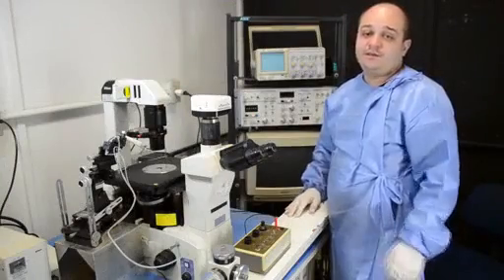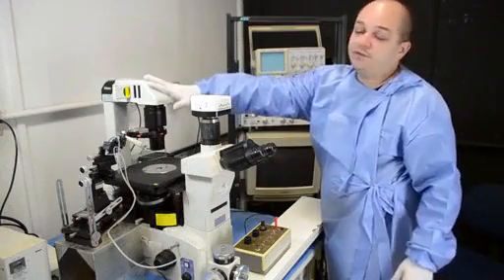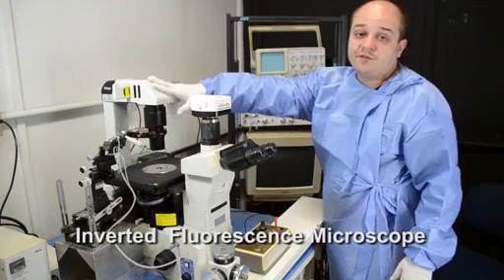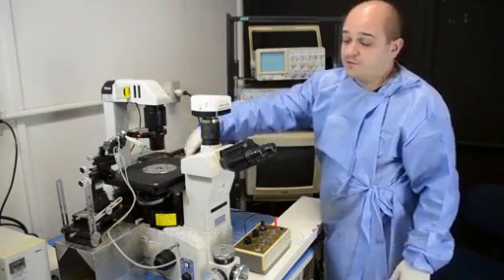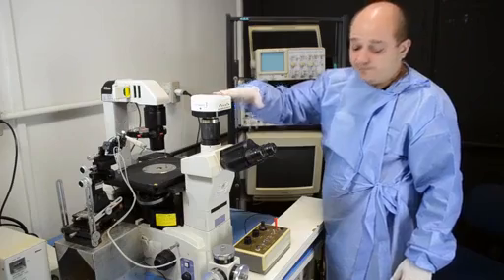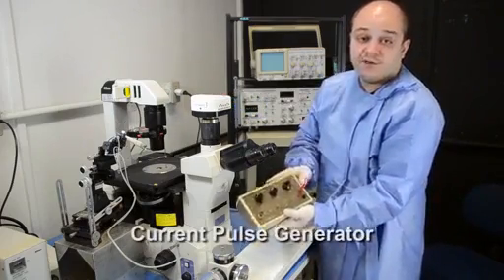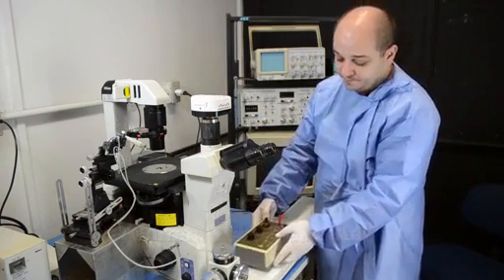Okay, let's see the basic components of the microinjection setup. Here we have the inverted fluorescence microscope. When we see the cells, this is a CCD camera to record the results. We have here the current generator that will introduce the dye into the cell.